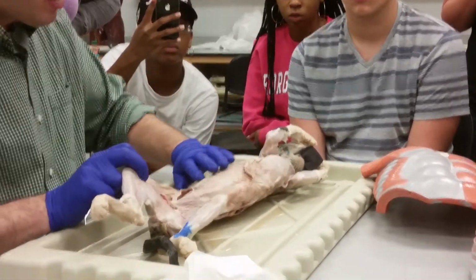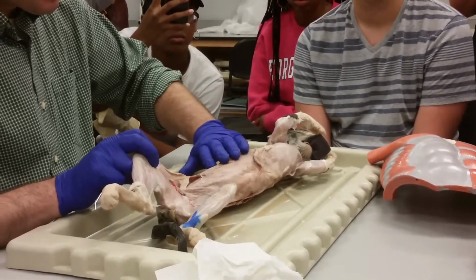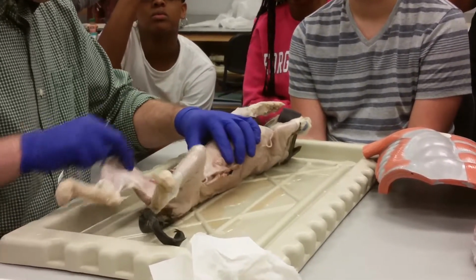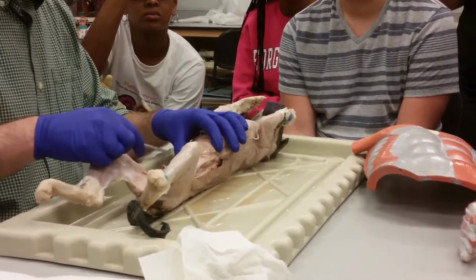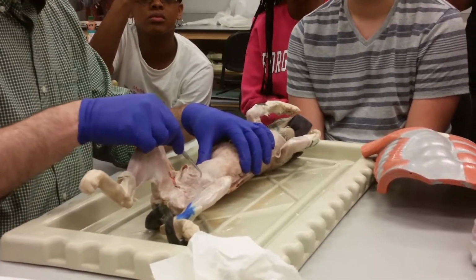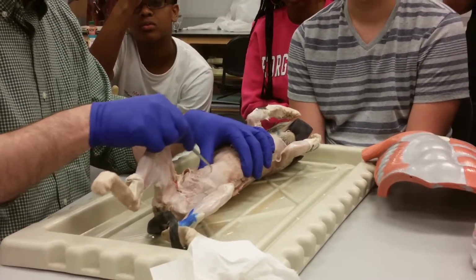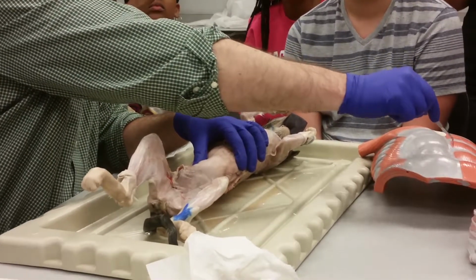It also spreads towards the midline, so it's going down at an angle, headed towards the pelvis and towards the midline. You can see where the midline is. In most animals like this, it's not quite as clear on this cat, but there is basically a line going down through here, a white line in the middle. It's called the linea alba, or white line. Here it is on the human.